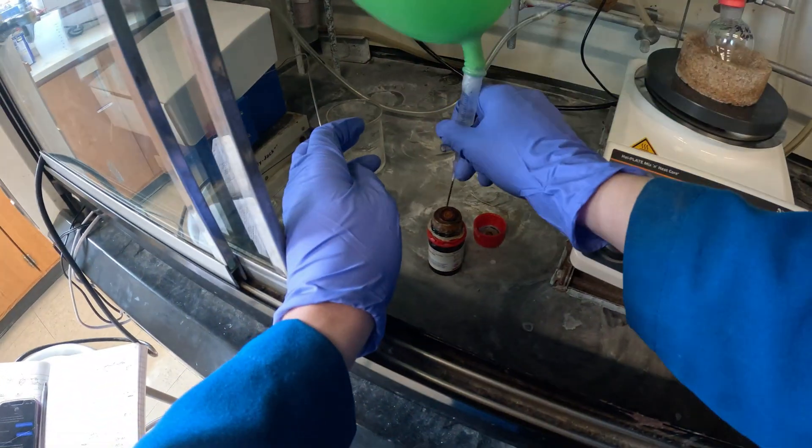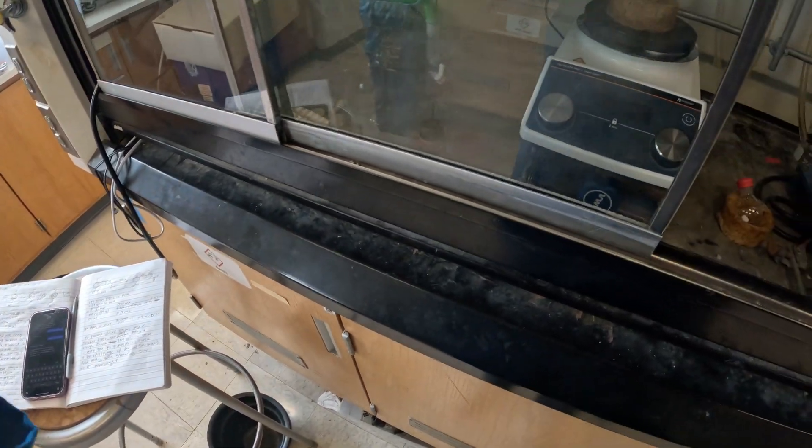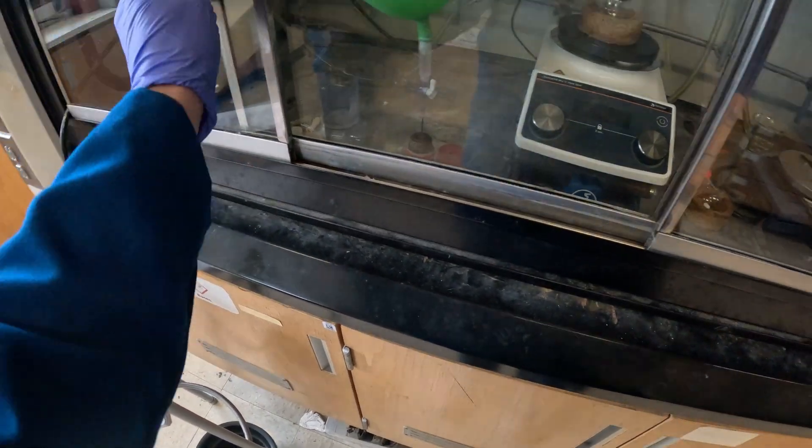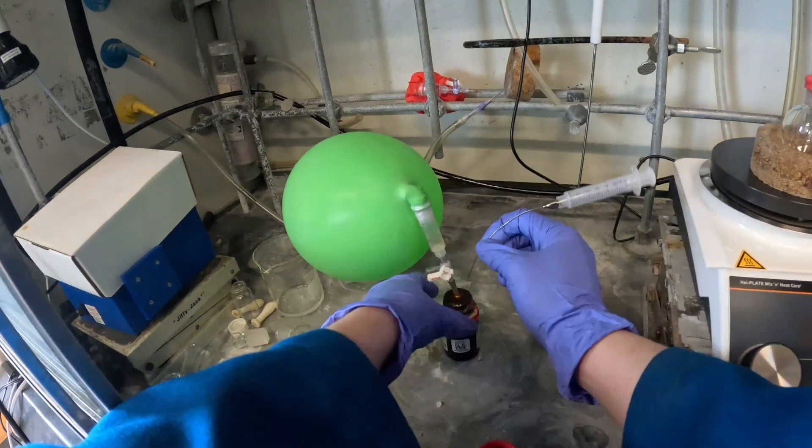I'm going to put in my argon balloon. That's disgusting. I'm just going to step back, walk away for a little bit, push that back. Okay, I'm back now. Let's do it.